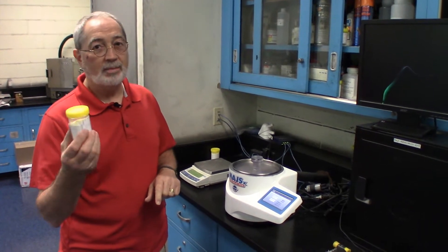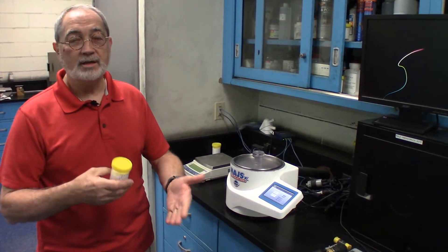Today, we're going to analyze powdered sugar to determine what the X value could be.